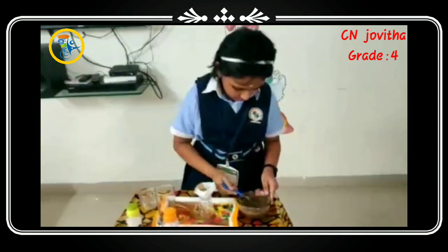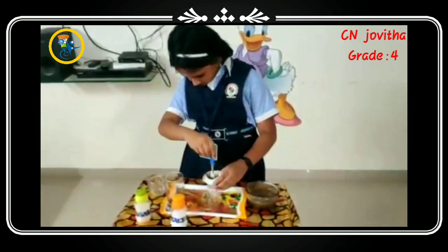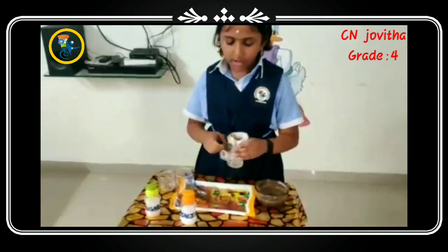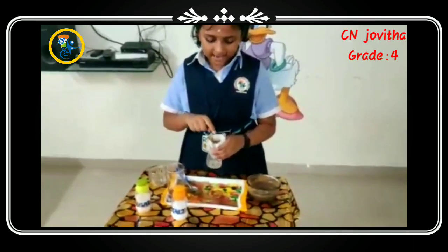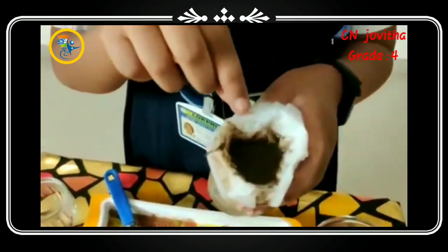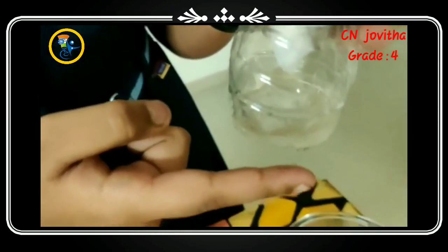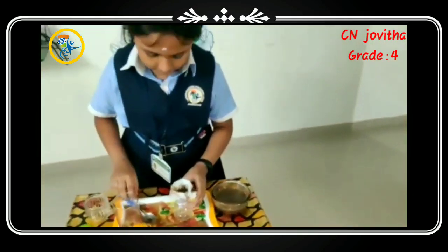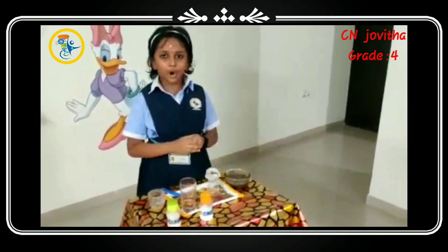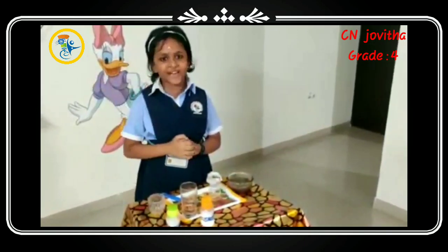Now let's see what it means — the sand is there in the filter paper, you can see. Now the little water is under the bottle. These are all about filtration. Hope you all understand about the filtration process. Thank you all for watching. Bye, be safe and take care.